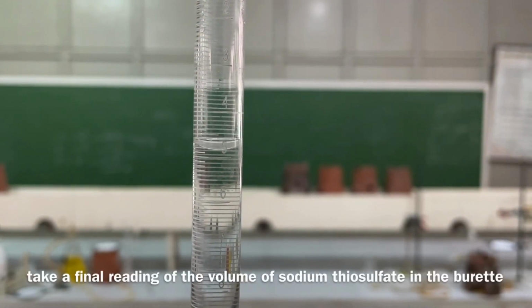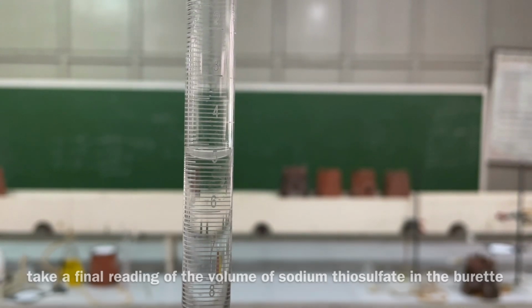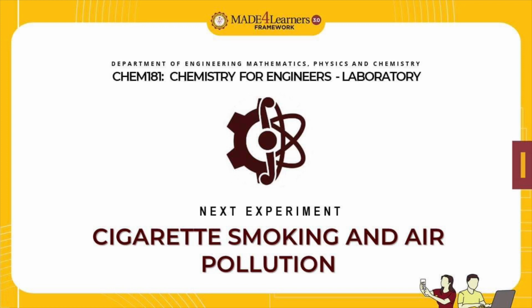Take a final reading of the volume of the sodium thiosulfate solution in the burette. The data for the other two trials will be given by your instructor.